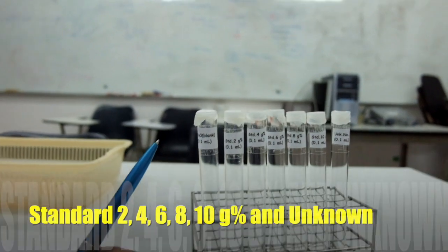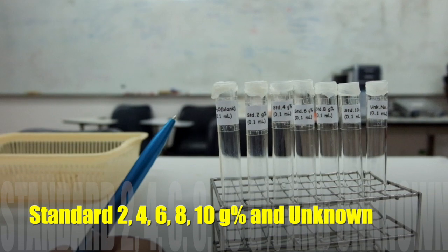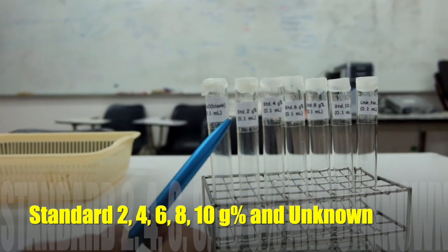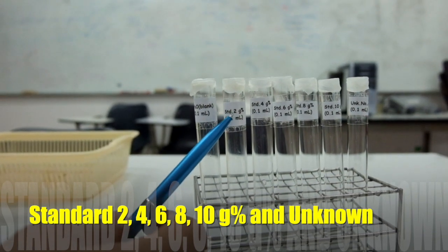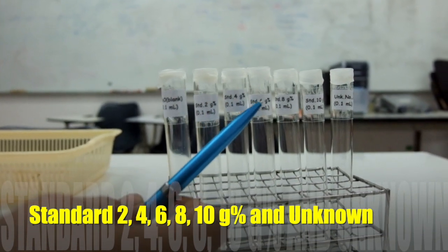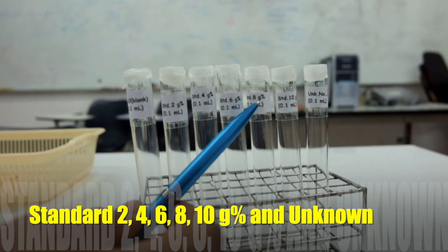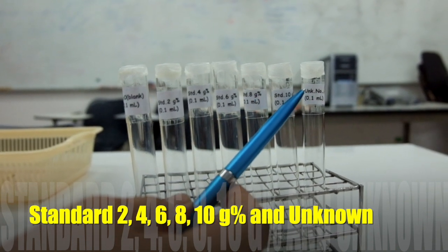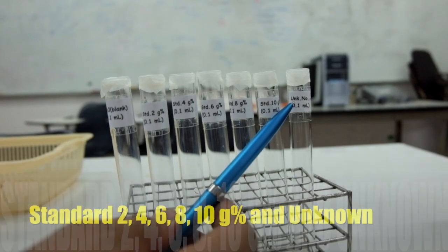Once you get the lambda max from the previous section, use that wavelength for measuring the absorbance of standard protein with known concentrations in the test tubes labeled standard 2, 4, 6, 8, 10 gram percent, and the absorbance of unknown protein in the test tube labeled unknown.